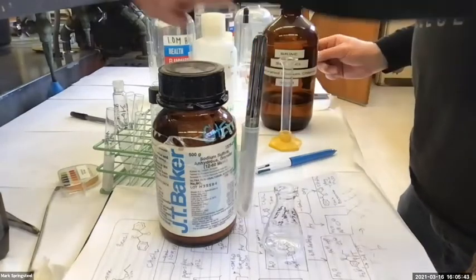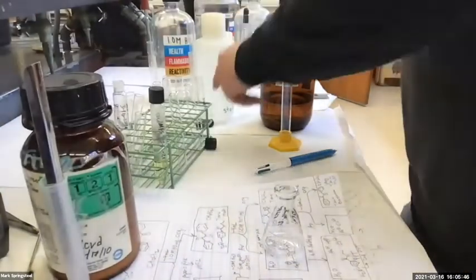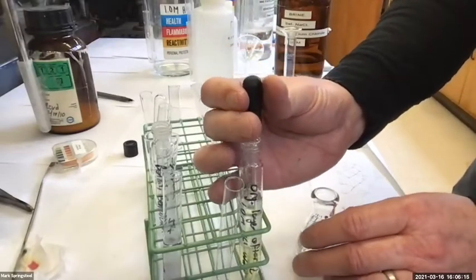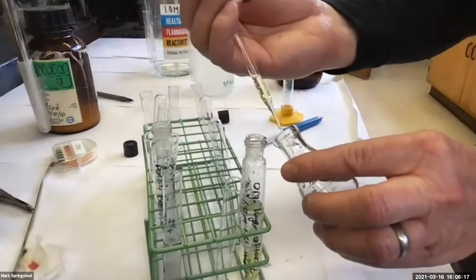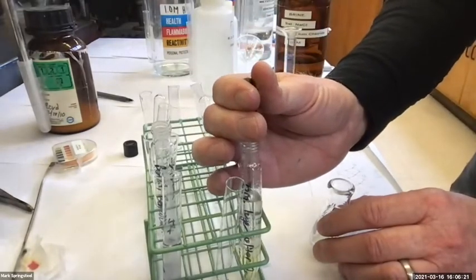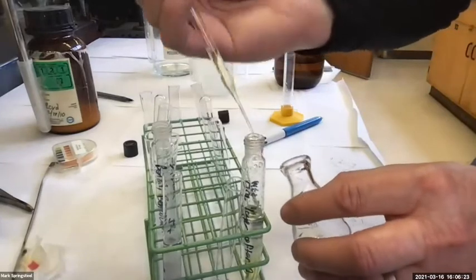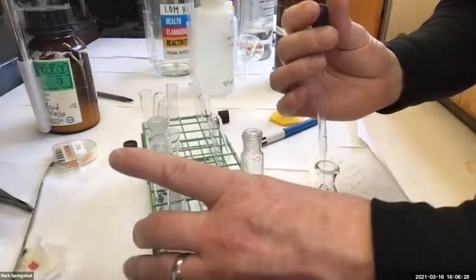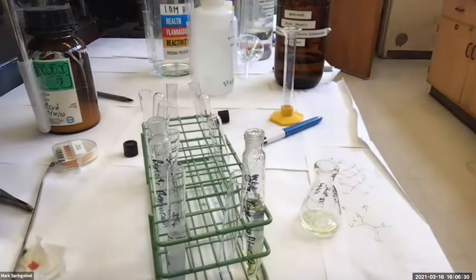So I wanna get my... I'm gonna push through the aqueous layer, enter the organic layer, draw it up, pull it out quickly, and put it in my Erlenmeyer. Can you guys see the bottom of the centrifuge tube? No, we can't. But I had a question. As you're pushing through the top layer, you're squishing the bulb so nothing gets in.